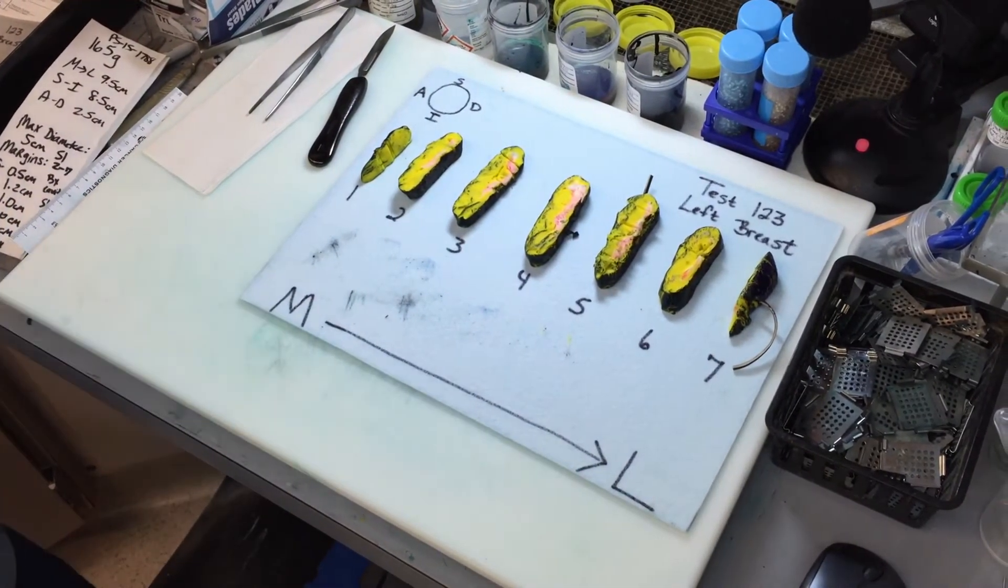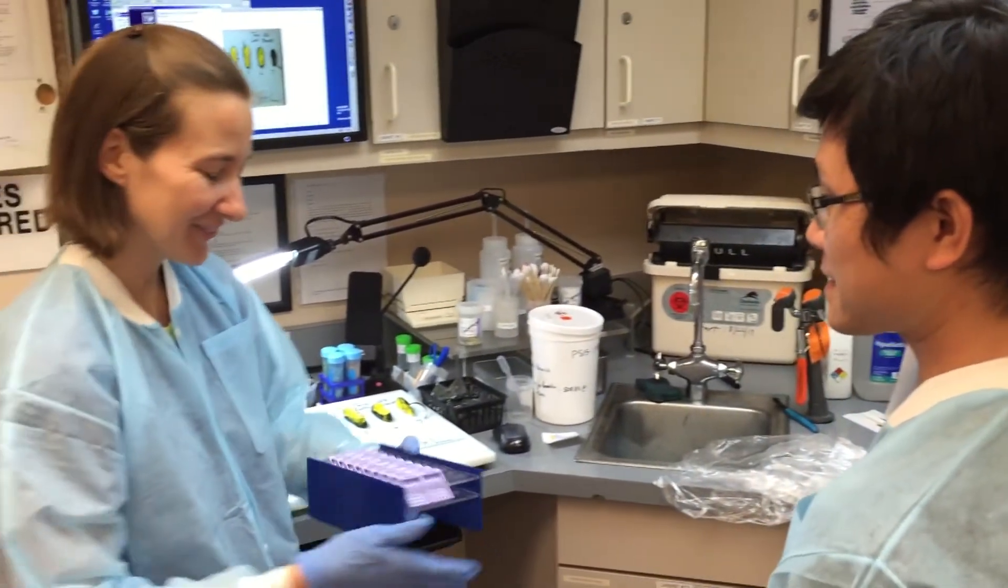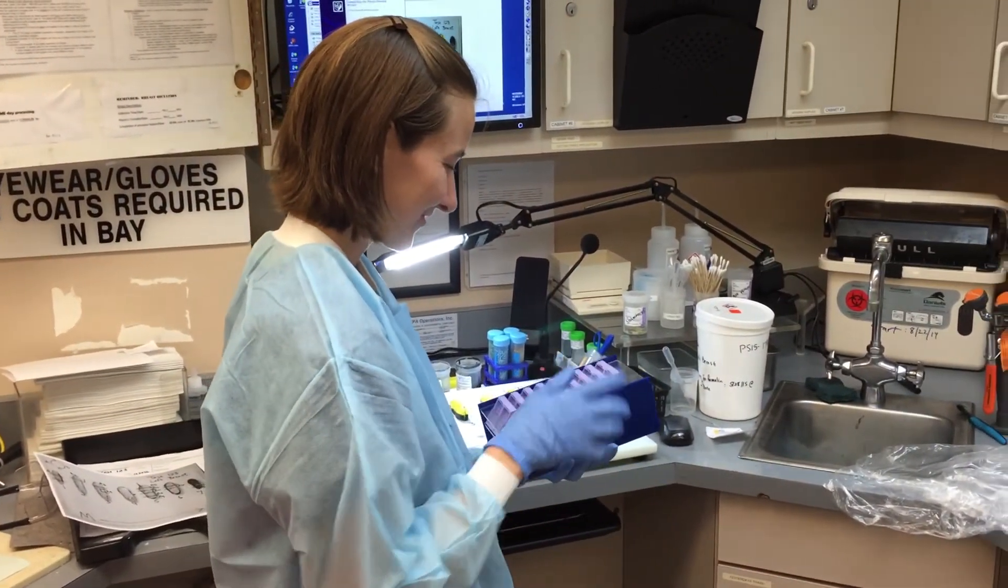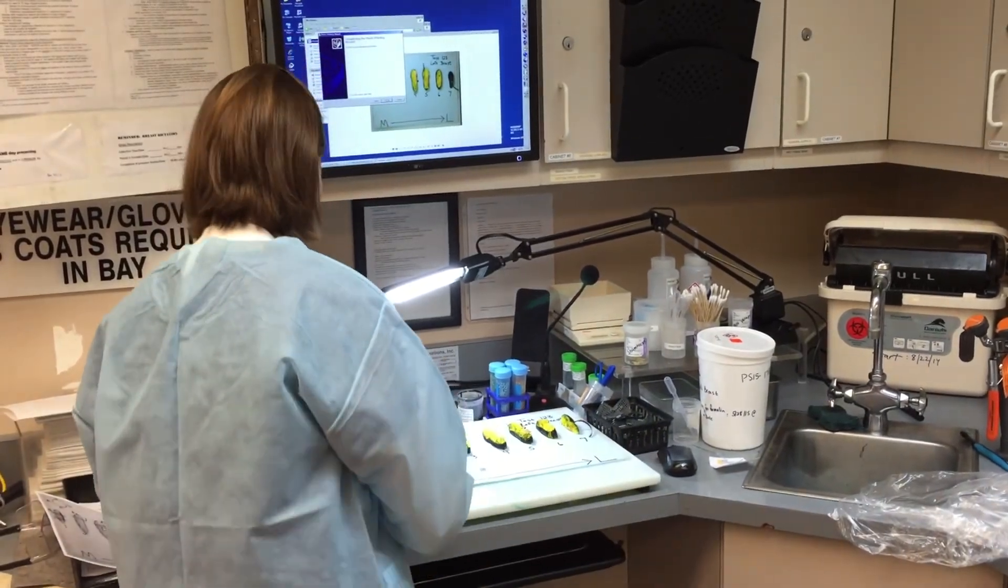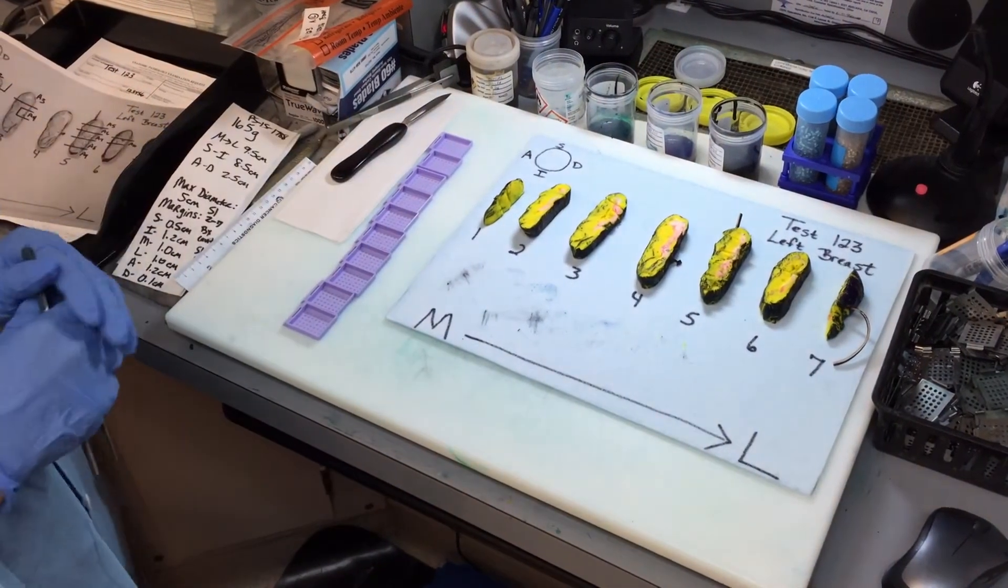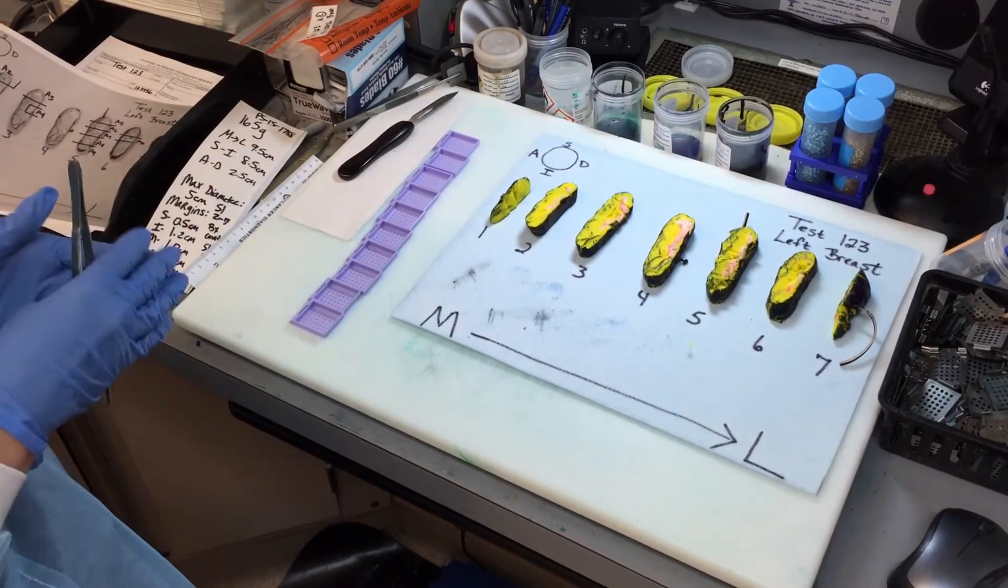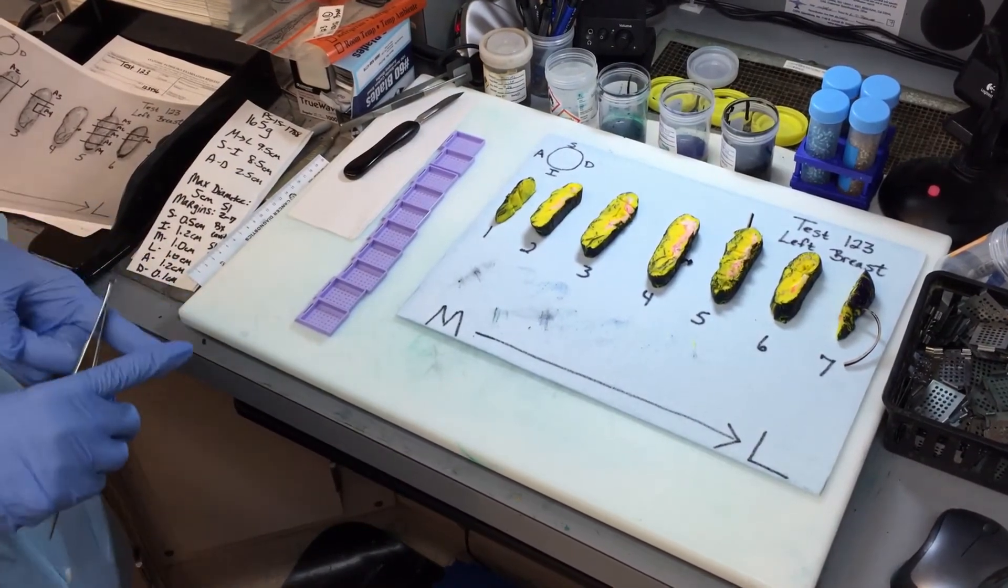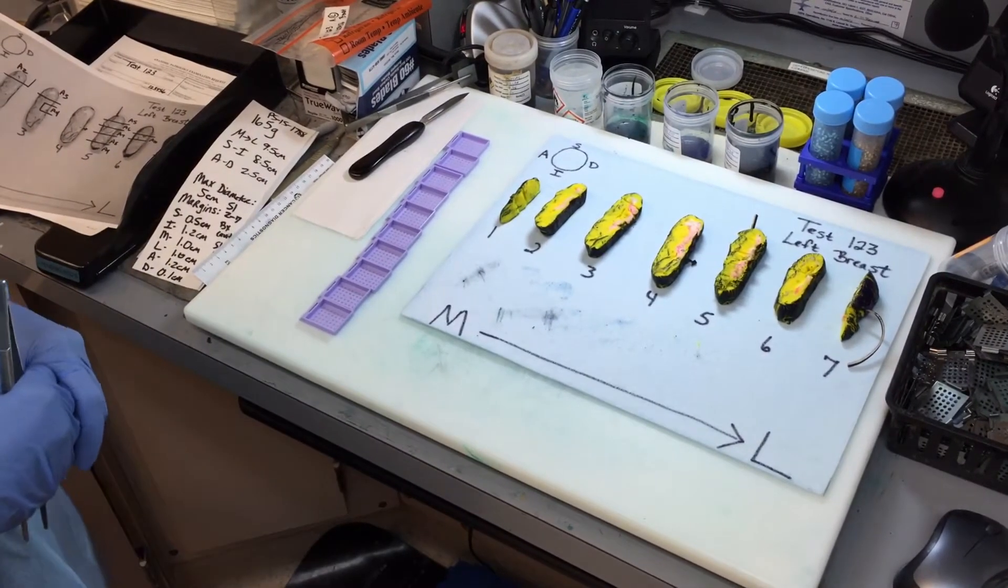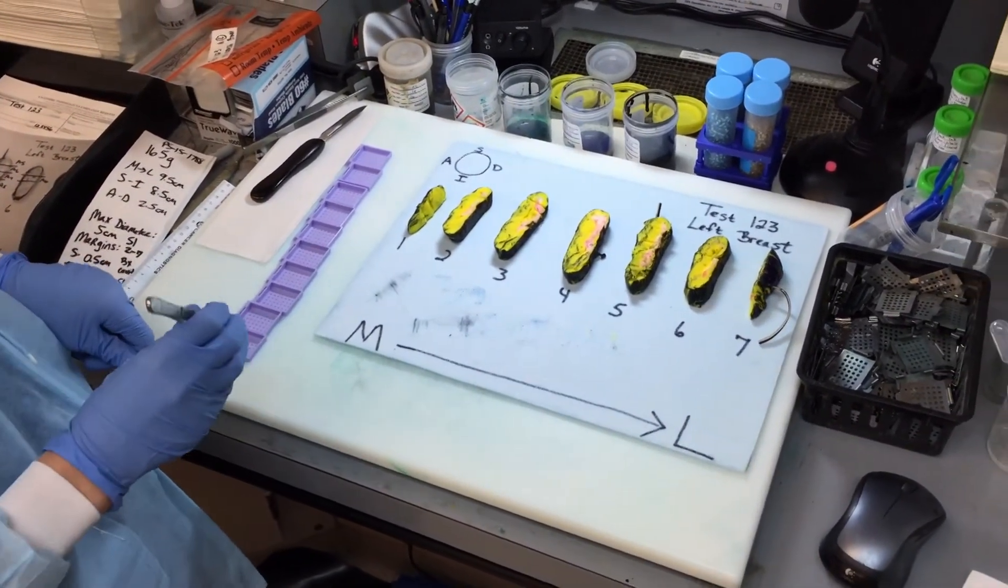You had a cap you wanted, though, too. Oh, thank you. Let me double check the numbers. Just double check. Okay, looks good. Okay, so when Anthony gave me the caps, I double checked them because we like to have our procedures in process and we need at least one person to check. So if you make them yourself, then you have to stop and ask somebody else to check your caps for you. So, now that we know that our numbers are correct, we can go on with putting the tissue in the blocks.